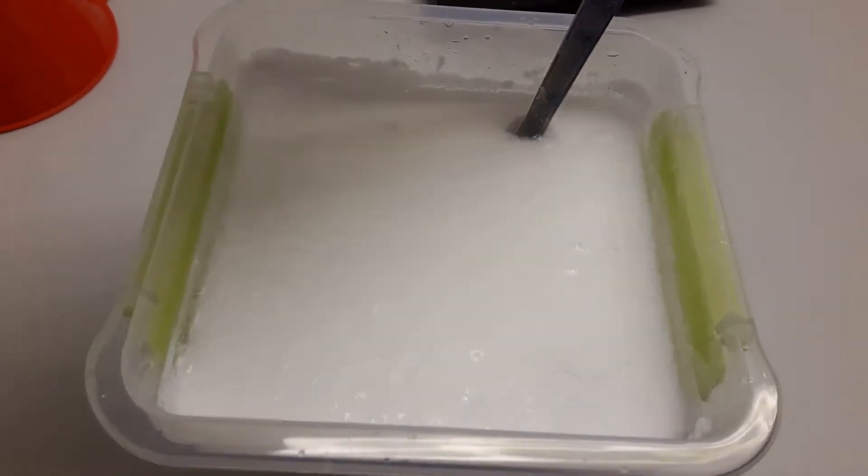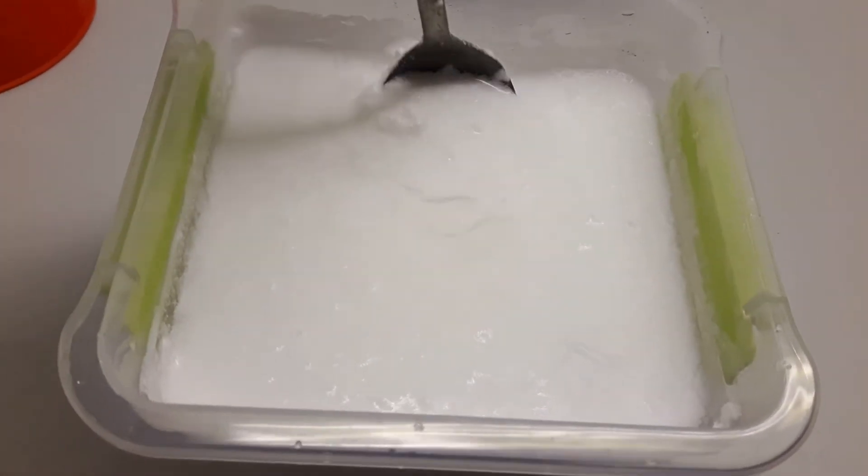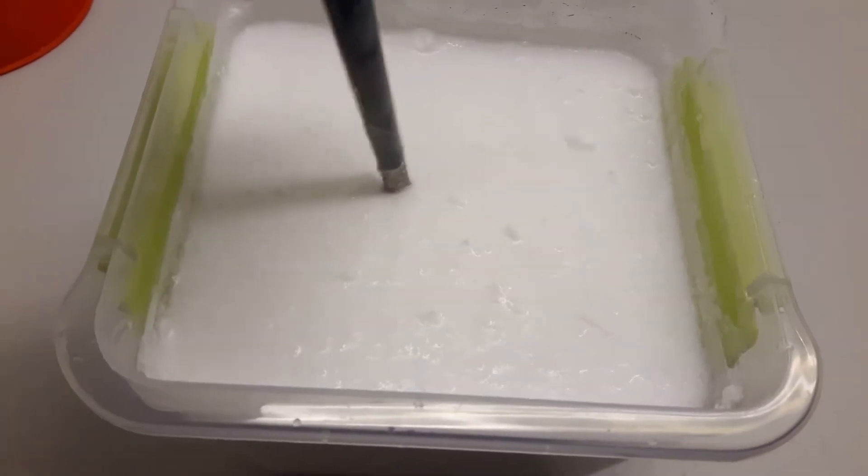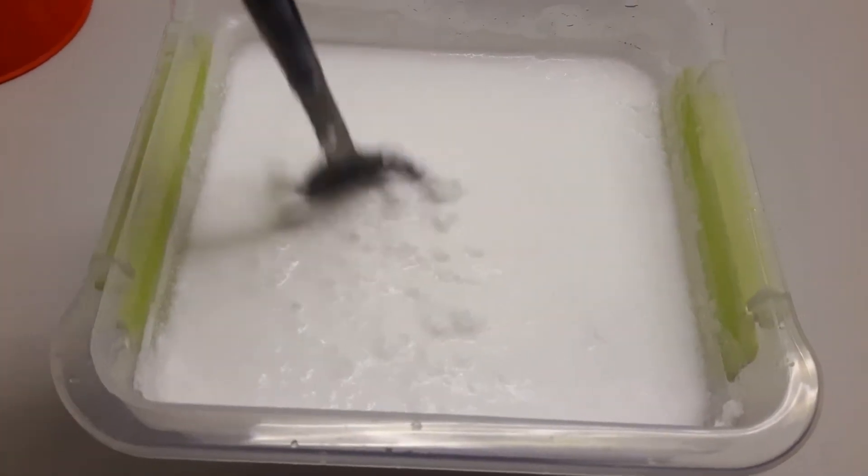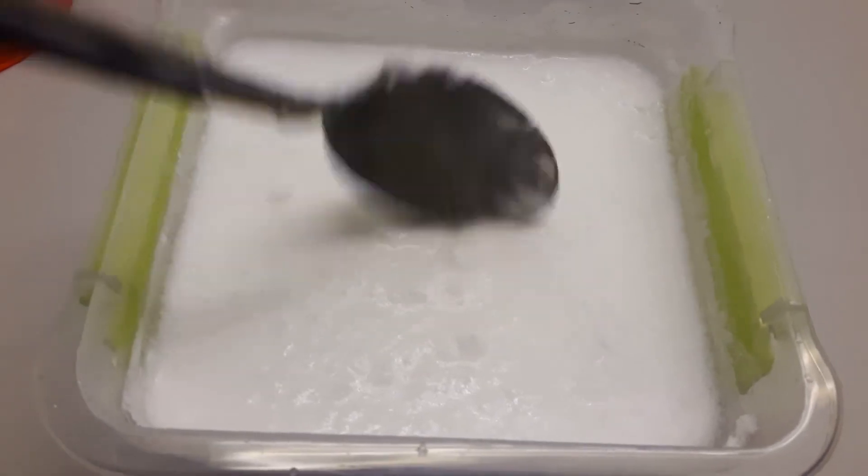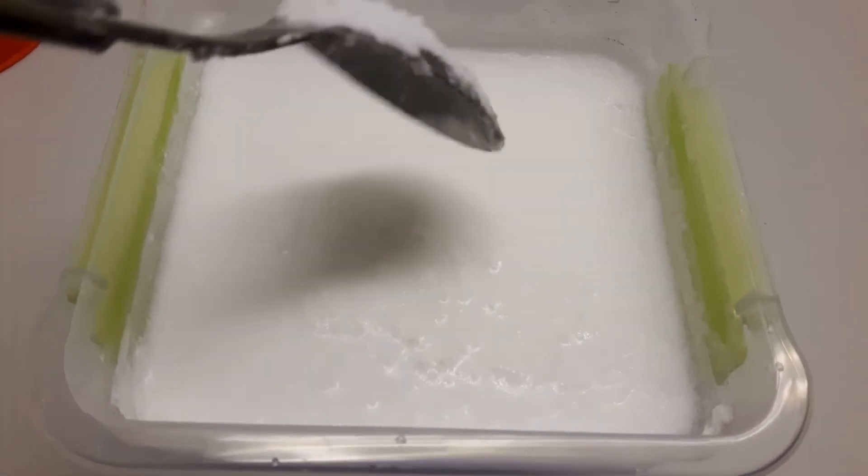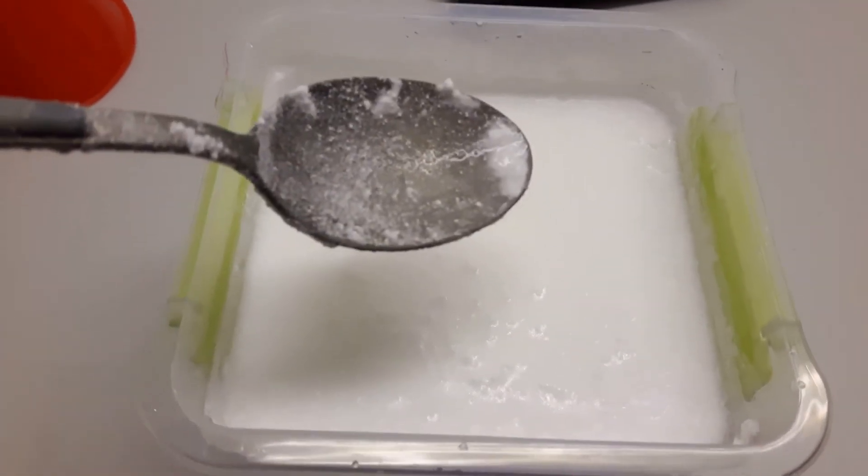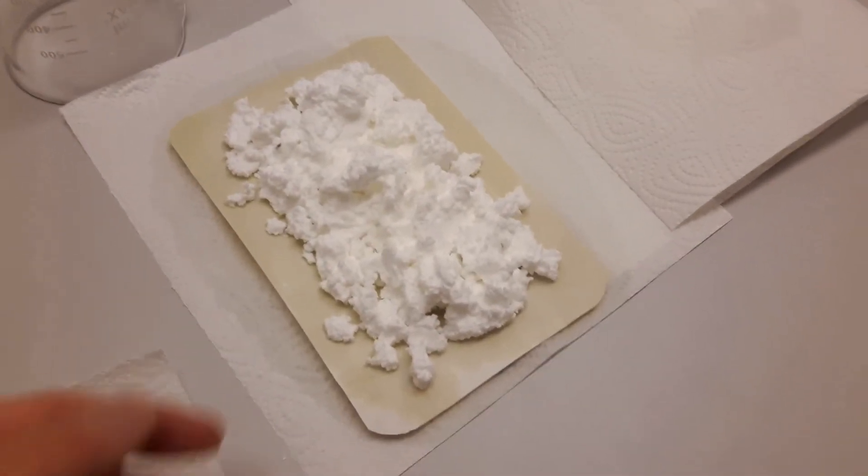This is basically raw material for vacuum filtration. I did not make a video of how I filtered it through, but you can probably use a coffee filter as well. I was impatient and did not want to wait.